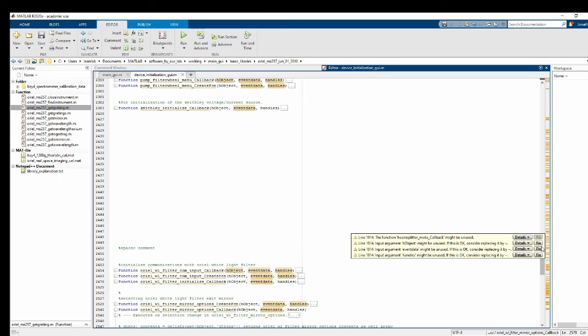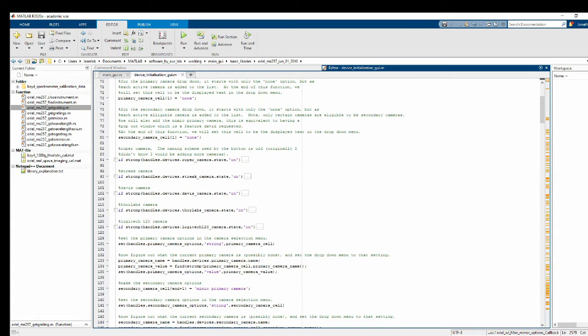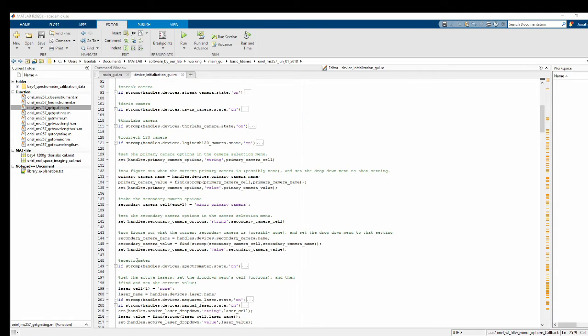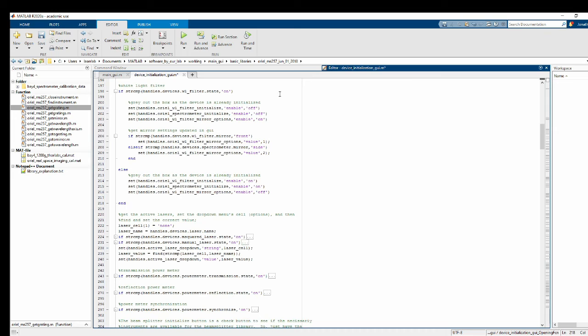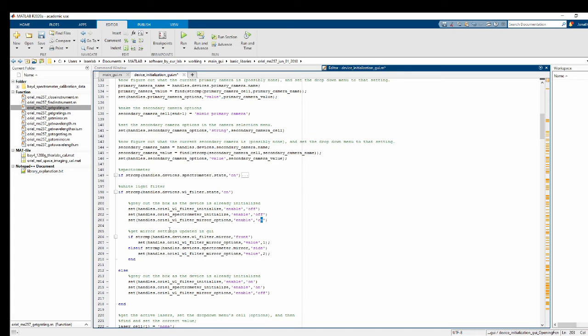I'm just going to check and see if, oh, well, it'll take care of itself in my opening function. So I'll do it this way. All right. So I've already got this code written out here, so let me just copy it, and I'm going to find the spectrometer and just put it right underneath that. Okay, so in the opening function for the device initialization GUI, if the white light filter is on, go ahead and turn the initialization button off. Also turn off the Oriel spectrometer initialize button, since they are the same device actually. And the Oriel filter mirror choosing drop down, turn that on. Alright, good. And get the current mirror settings and update it to whatever is going on in there.